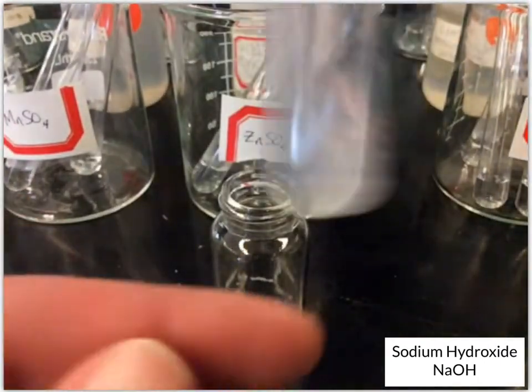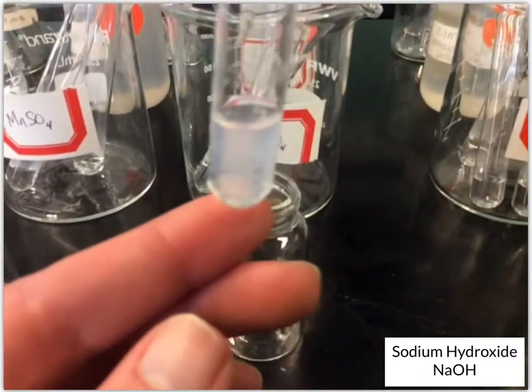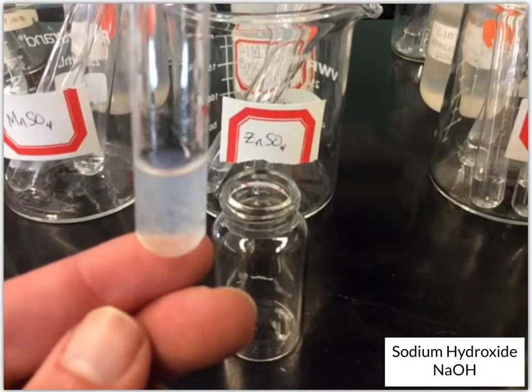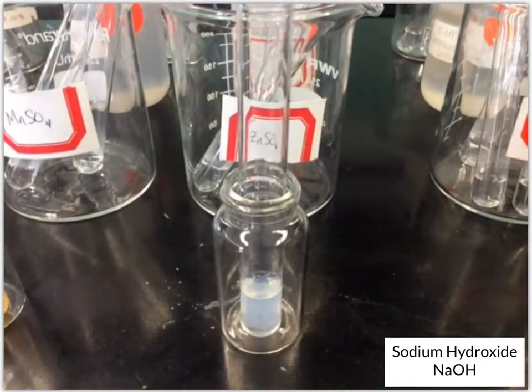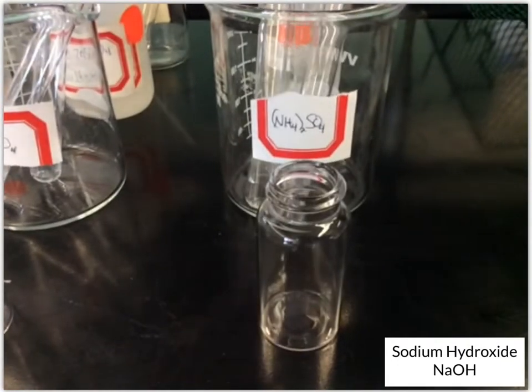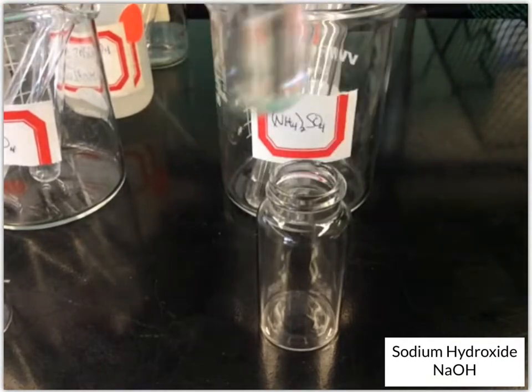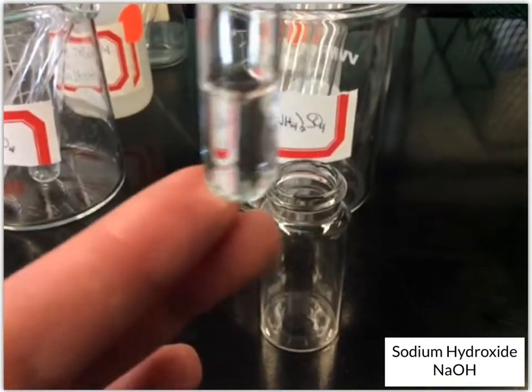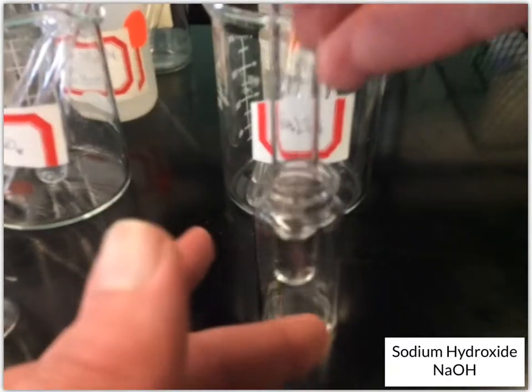Okay, so this one looks like you also have some stuff forming. It's kind of got that cloudiness. You've actually got some particles you can see floating in there. So we'll give that one a chance to settle as well. And lastly, the ammonium sulfate. And another just clear, colorless solution.